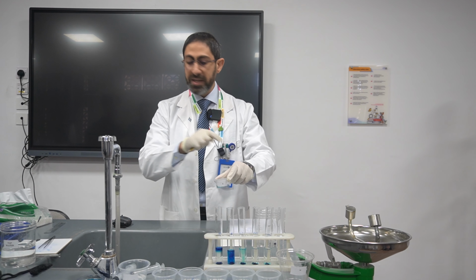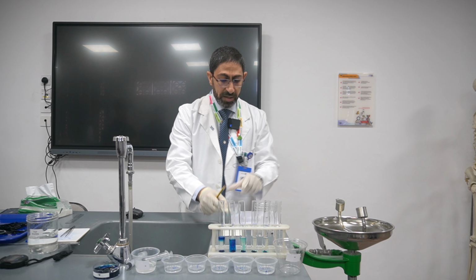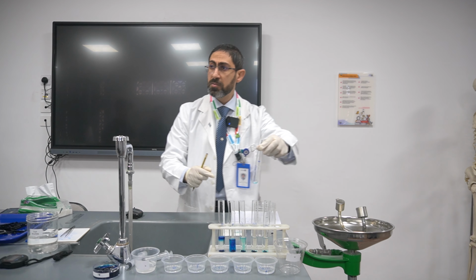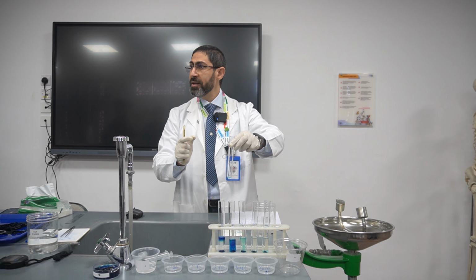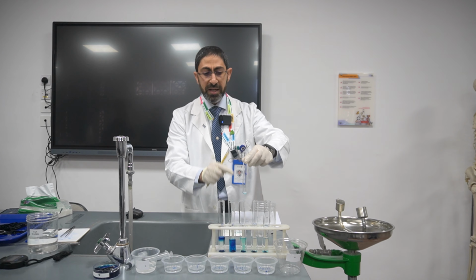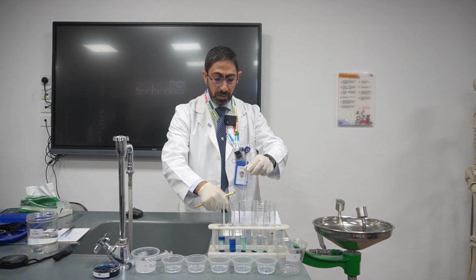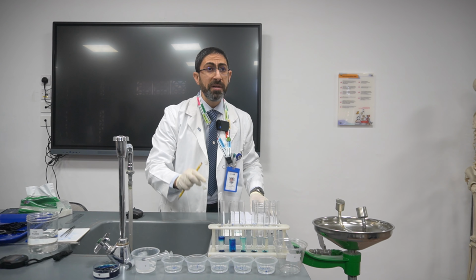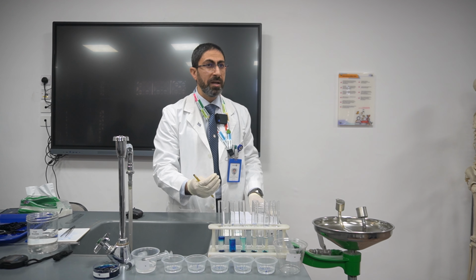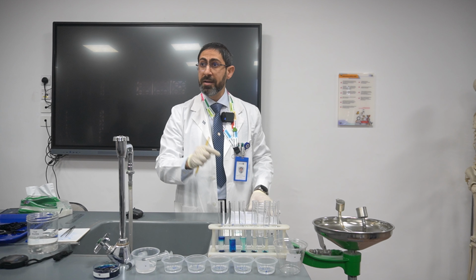The net movement of water inside is higher, because in this case it's distilled water. The distilled water is a high water potential solution. So the water will be moving from a region of high water potential, in this case the distilled water, to a region of lower water potential, which is inside the potato. So the color intensity of the potato will be less, because more water gets in. So the methylene blue dye inside the plant tissue is diluted.